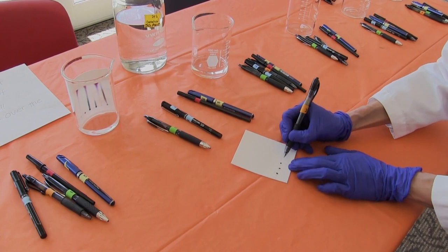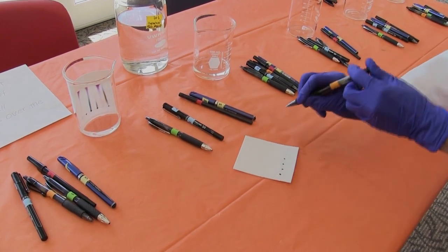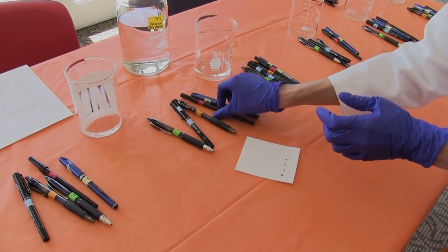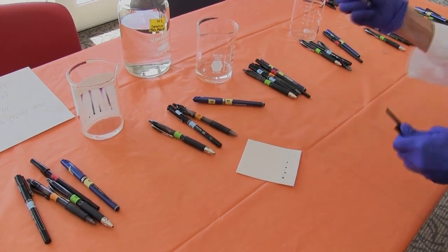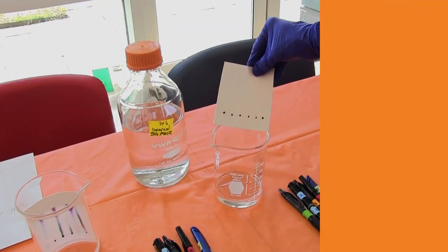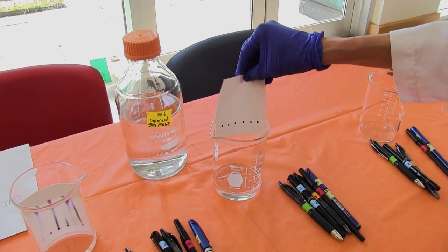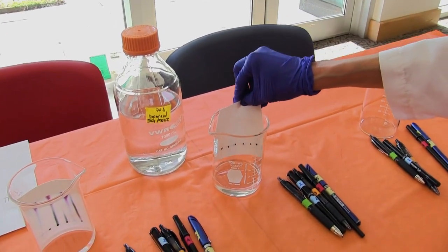Each of the suspects also had a pen in their pocket, so we're going to use chromatography to separate the colors of the ink on the pens found with the suspects and compare them with the ink found on the note at the scene of the crime.